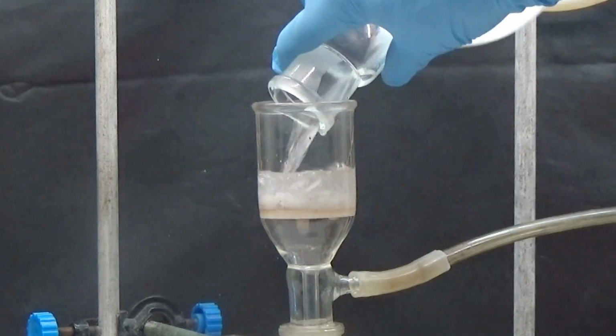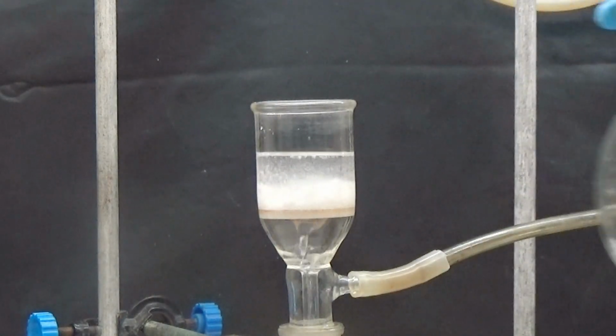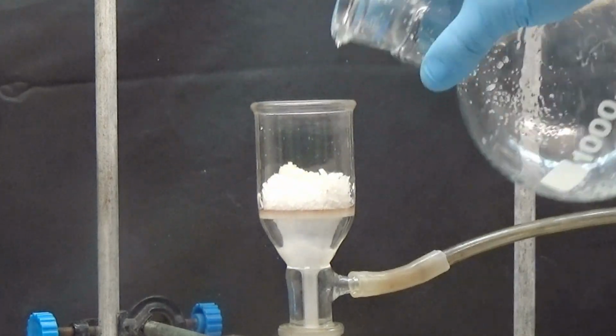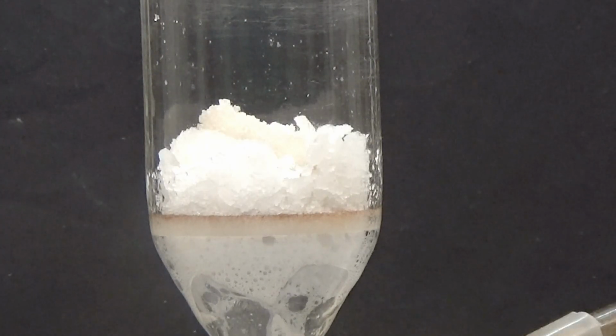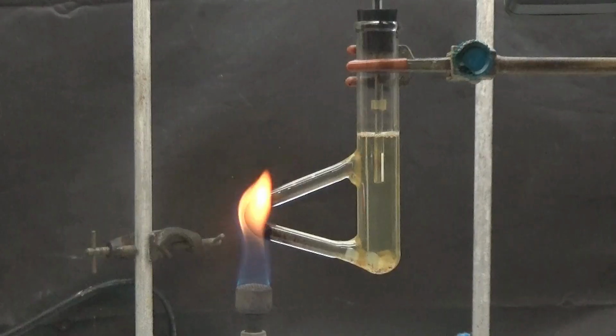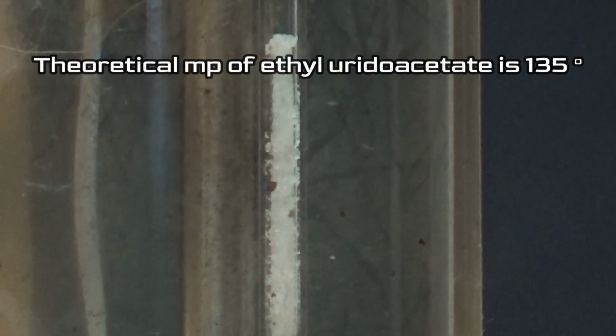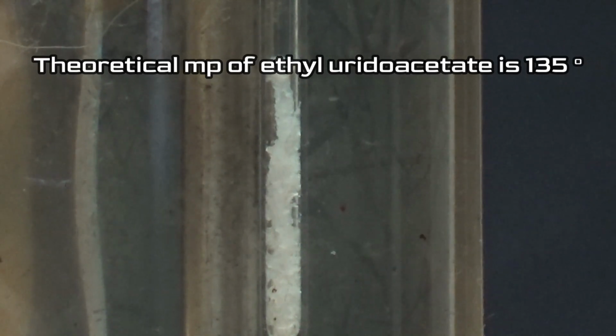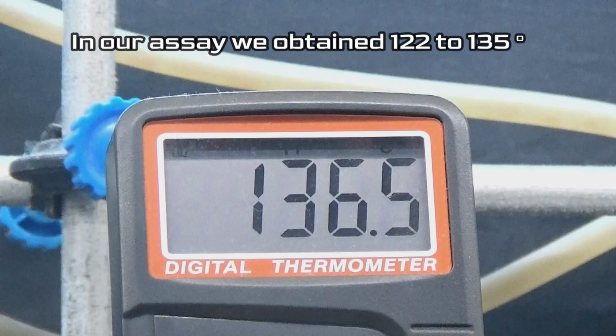Allow to cool and store in refrigerator for 12 hours to crystallize. White crystals are obtained and collected by suction. Dry the product in an oven at 60 degrees for 4 hours. Determine the melting point. The theoretical melting point of ethyl uridoacetate is 135 degrees. In our assay we obtained a very wide value, from 122 to 135 degrees.